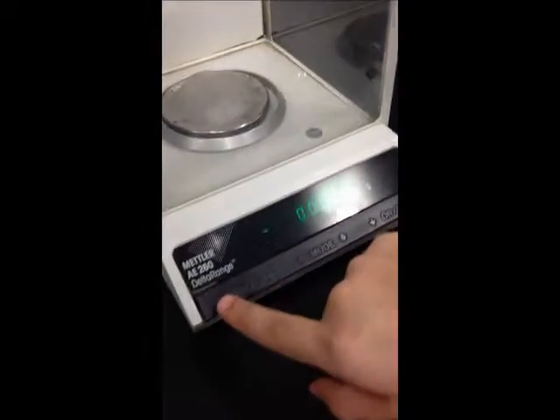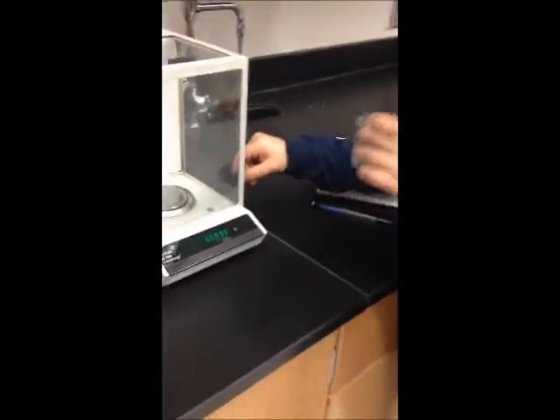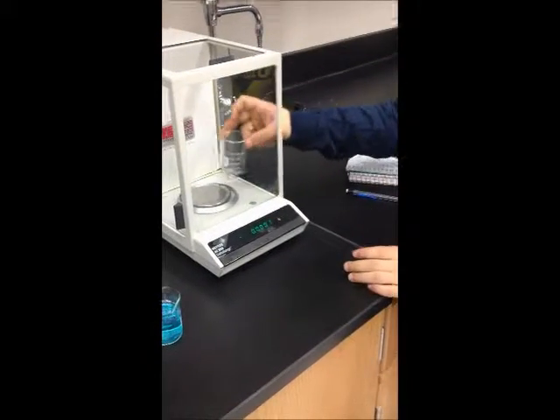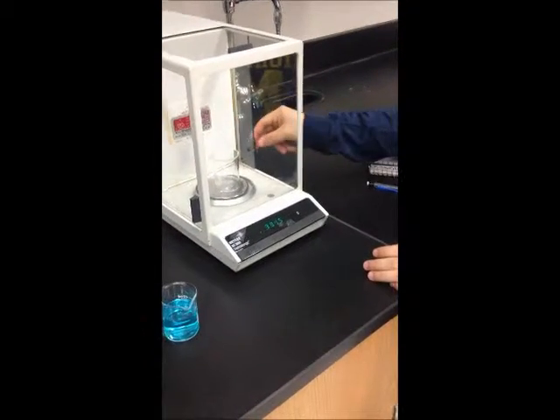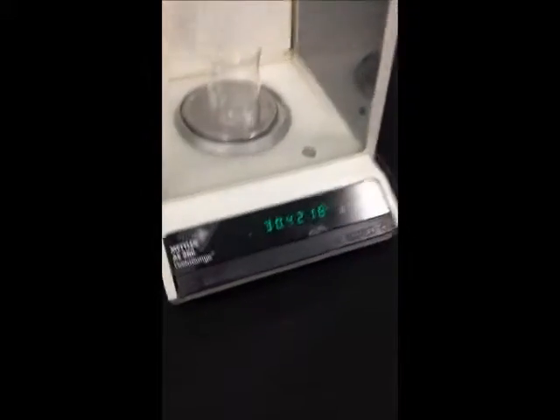Now lab partner number 1 will perform calculating the mass by difference of a solution. Start by taring the balance so it's completely at zero. Open the side door on the balance and place the beaker inside. Make sure to close the side door to prevent getting inaccurate data because of air currents. Wait for the scale to stabilize before you record the value.